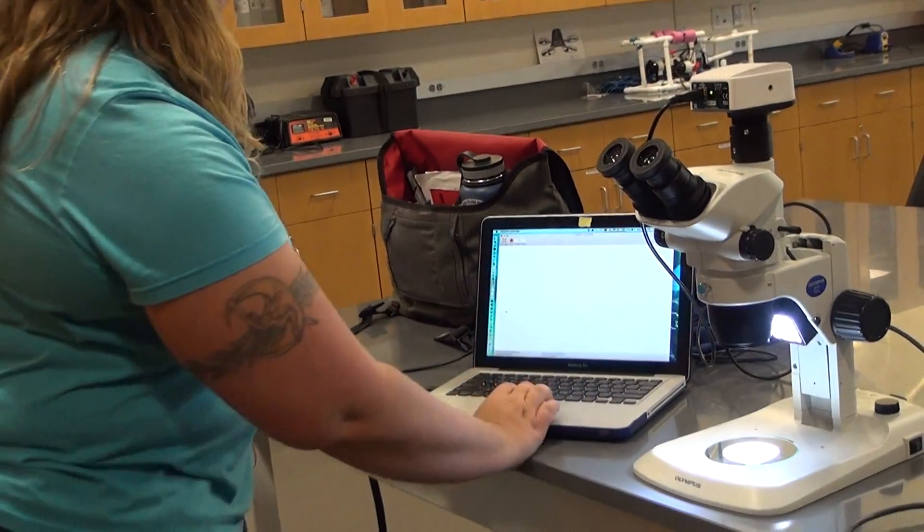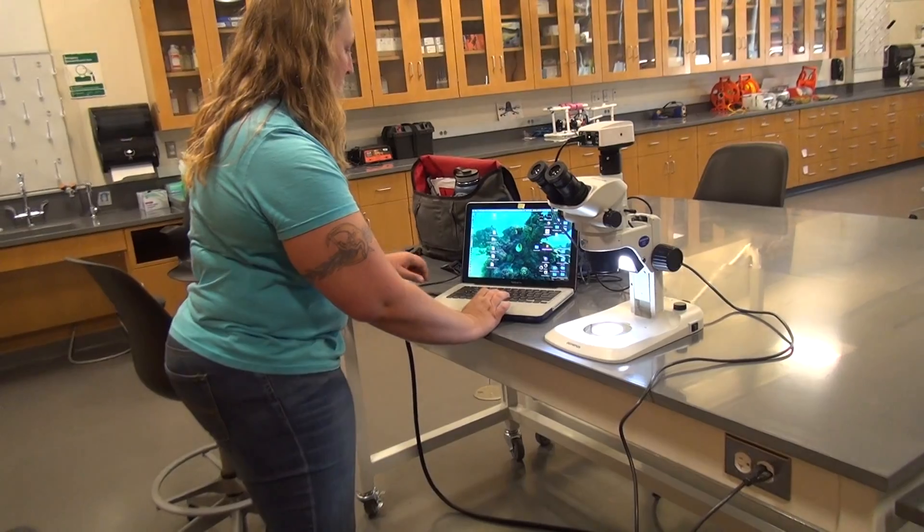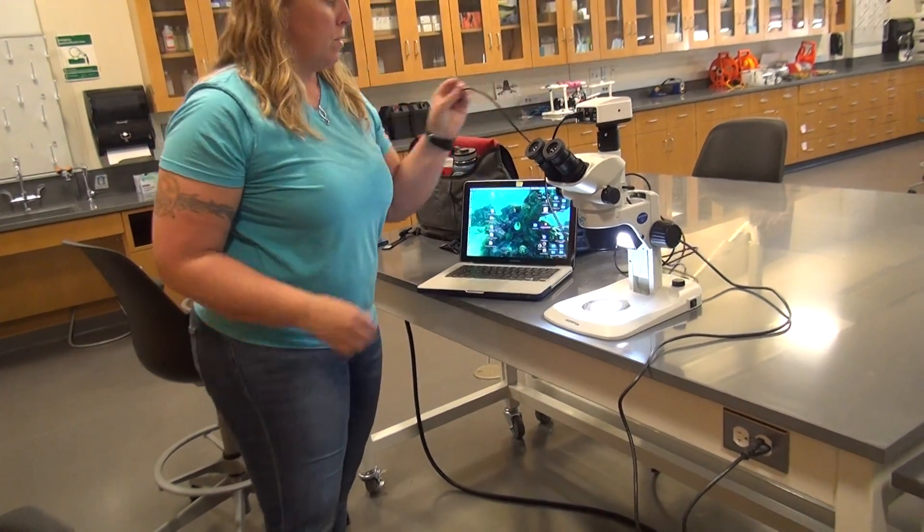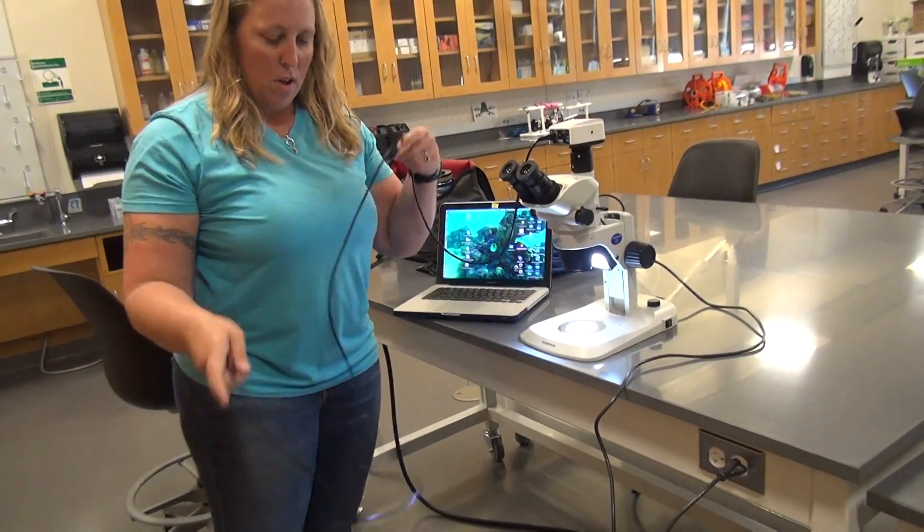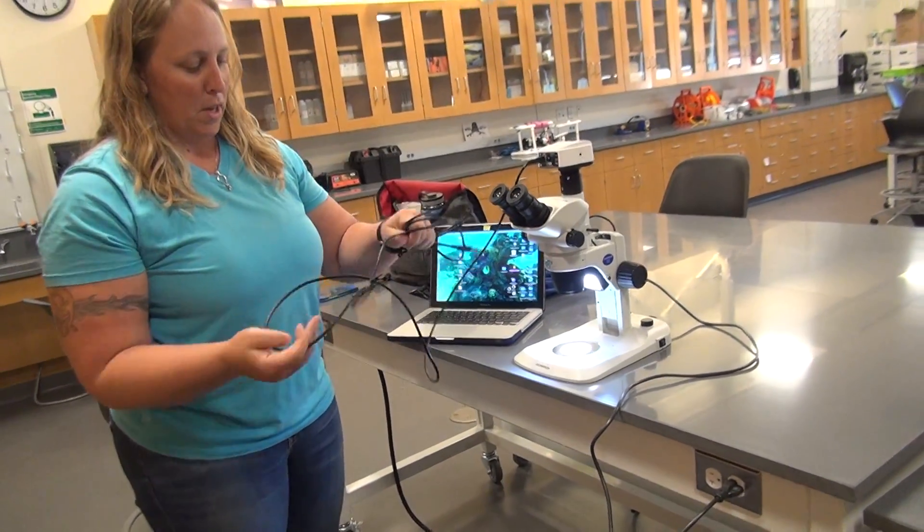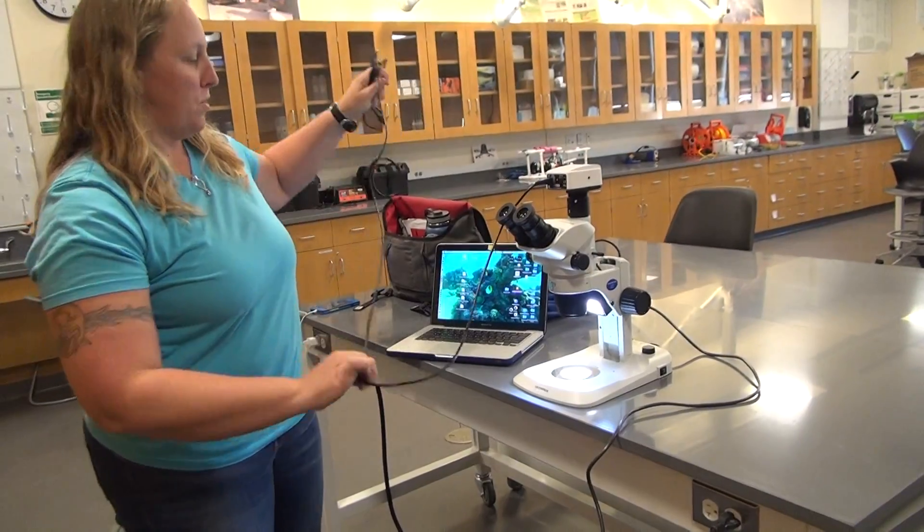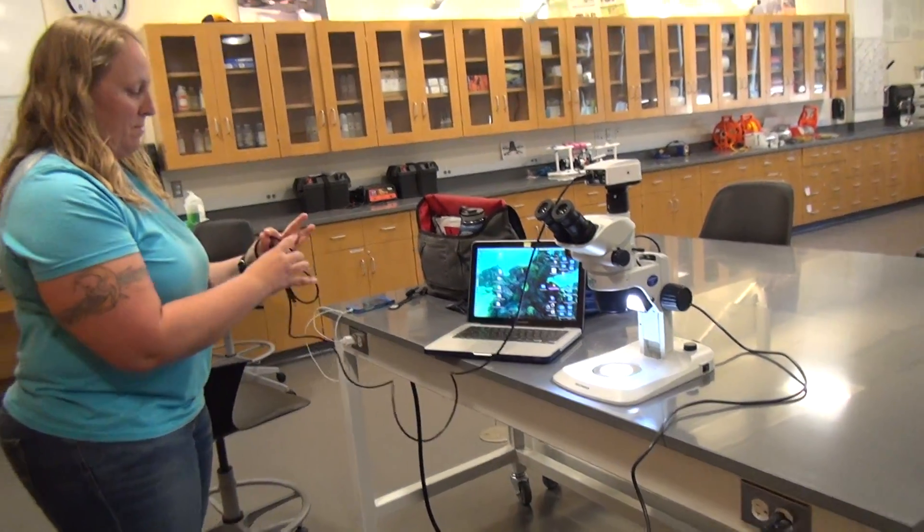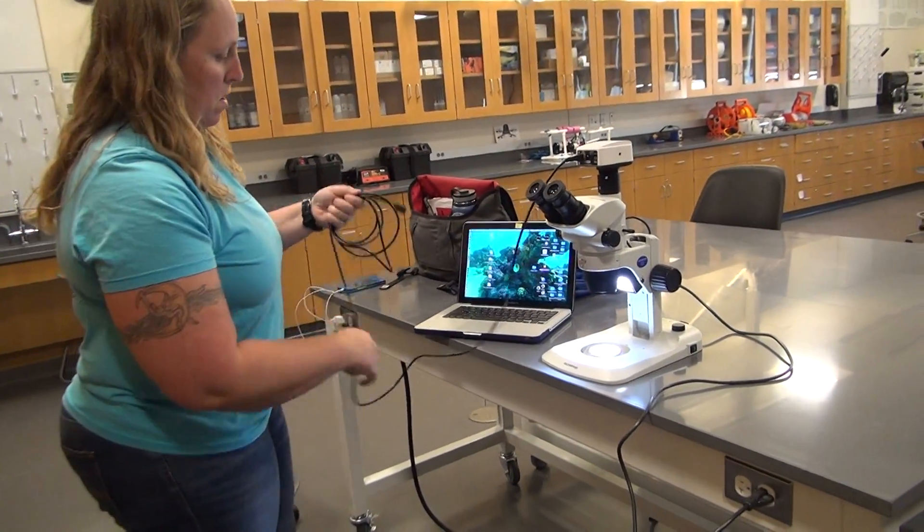When you go to turn it off, close the program. Disconnect from your computer. Be very, very careful with this special cord. So I usually wind it up really nicely. It's not very nice right now.